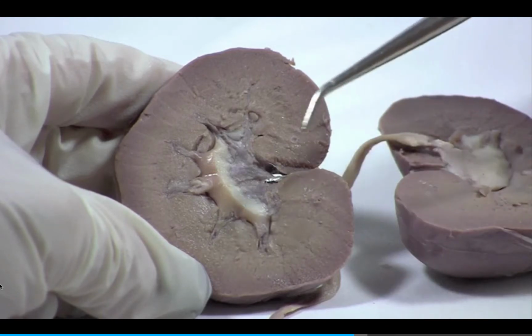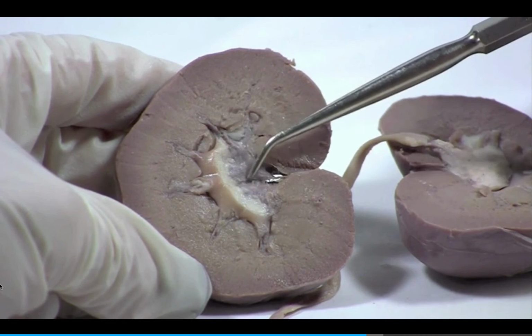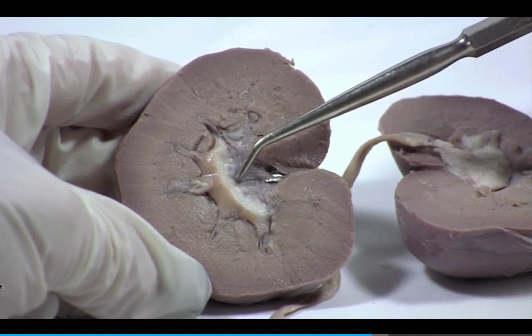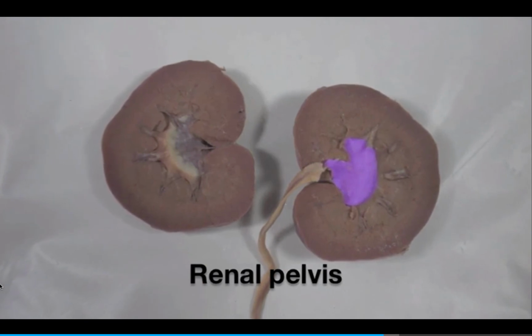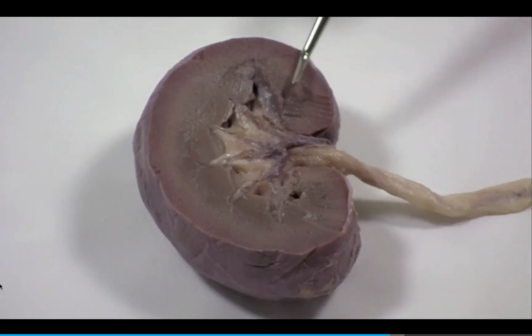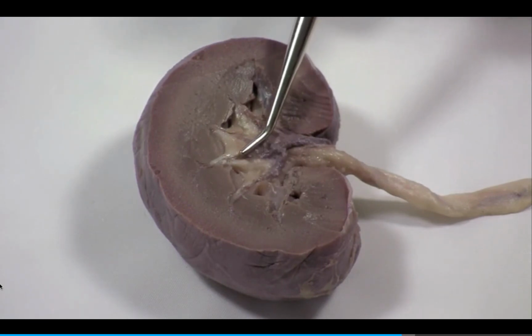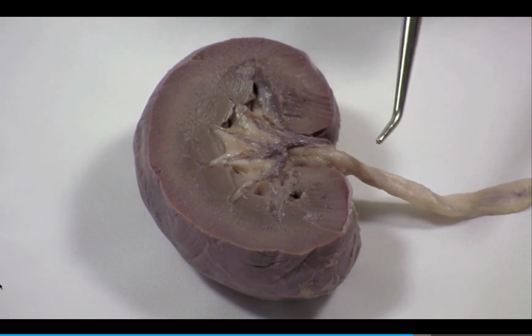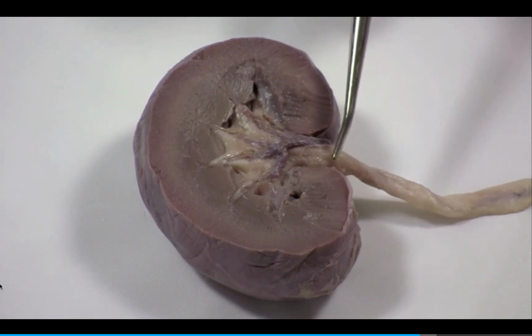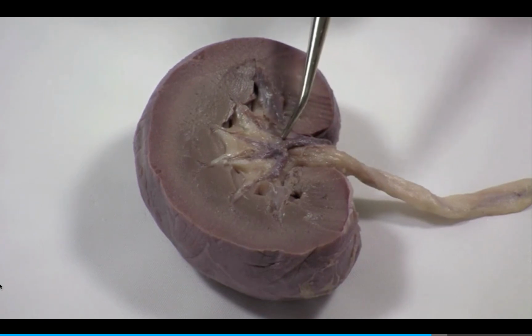The central core of the kidney is occupied by the renal pelvis and adipose tissue. The renal pelvis is the funnel-shaped top of the ureter. Here, I've cleared away some of the tissue of the kidney to show the branching of the renal pelvis. The branches of the renal pelvis are called calyces. The major branches are called the major calyces.